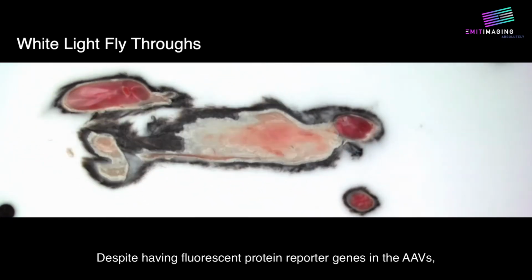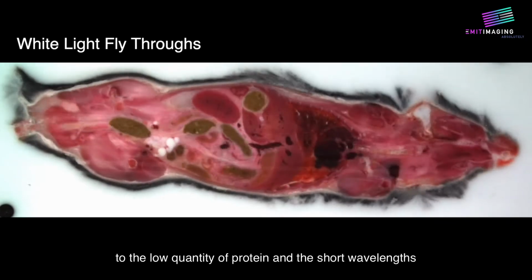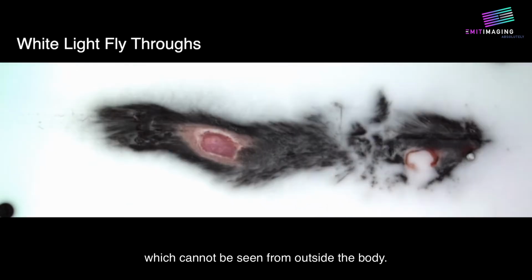Despite having fluorescent reporter genes in the AAVs, whole animal imaging is difficult due to the low quantity of protein and the short wavelengths, which cannot be seen from outside the body.